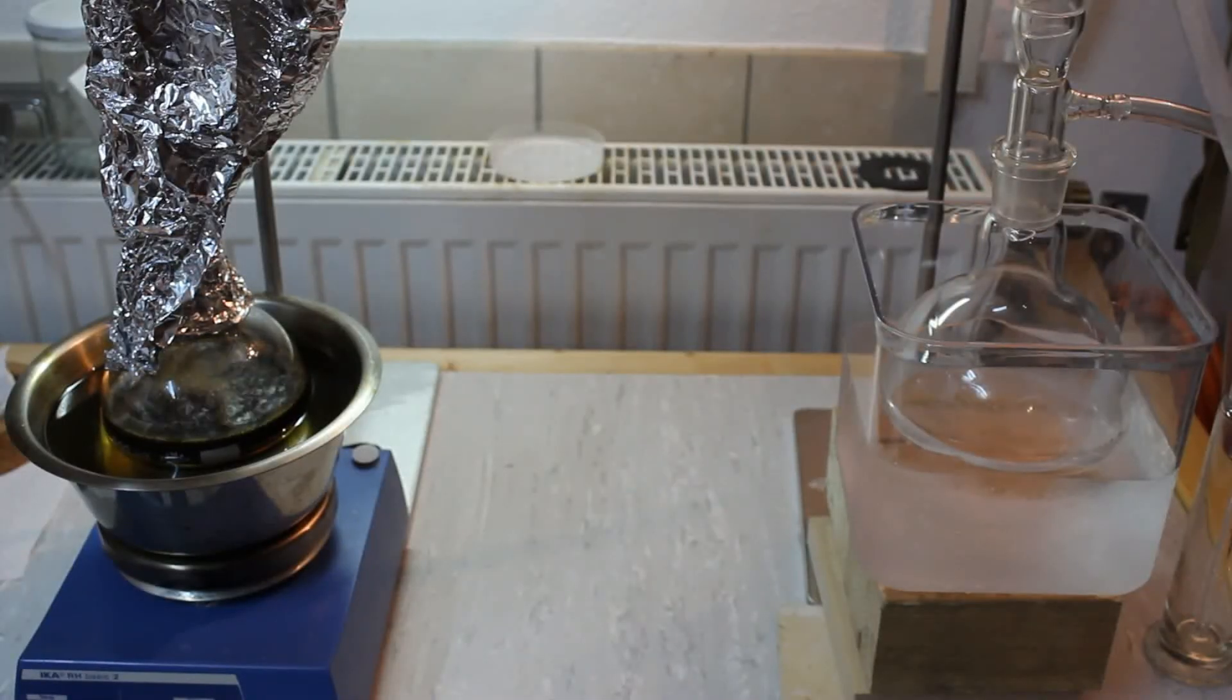All of the ethanol has been added. So I'm now going to keep the distillation running until the stillhead temperature rises and the rate of collection slows down.